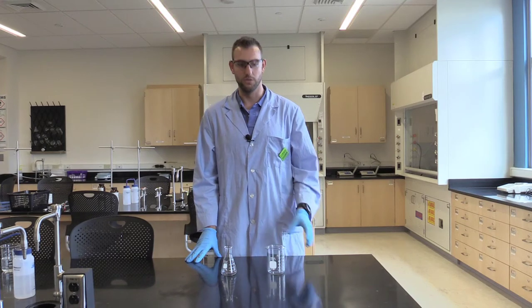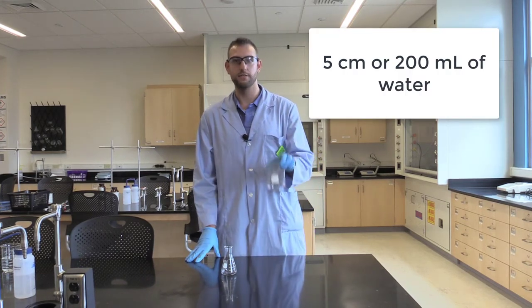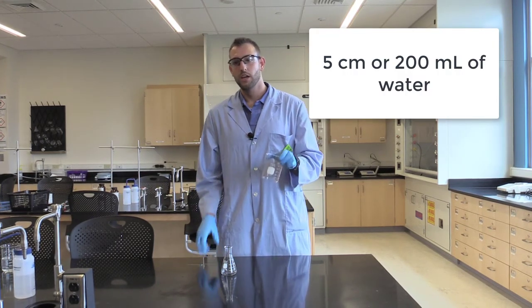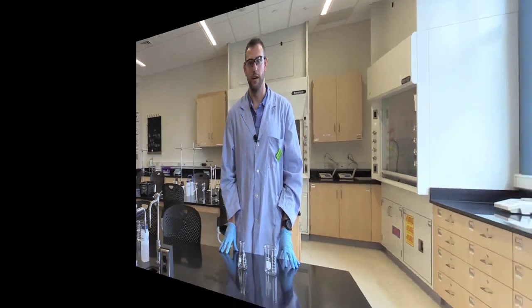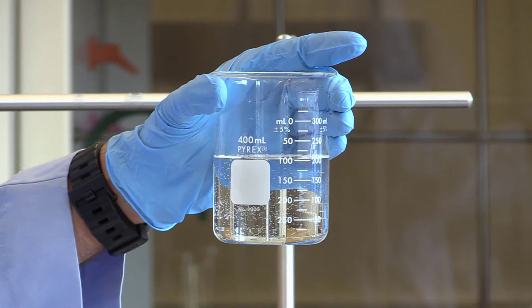To start, we need a beaker and fill it with water. We're using a 400 mL beaker that we'll set up as a water bath. I've filled it and added two boiling chips, which are needed to help the water heat evenly.